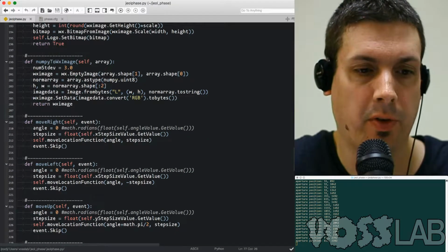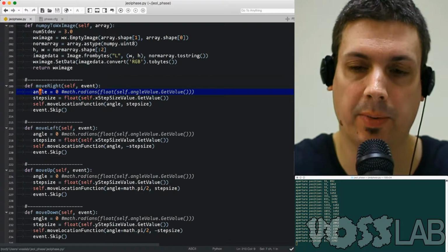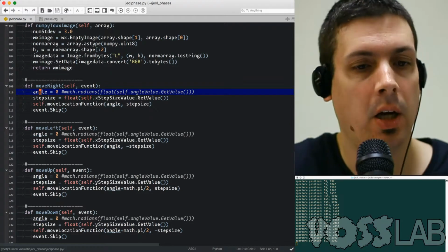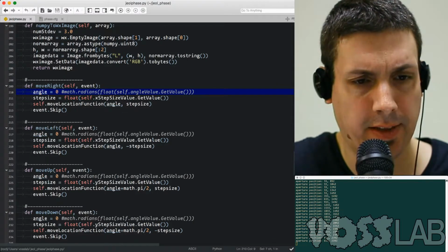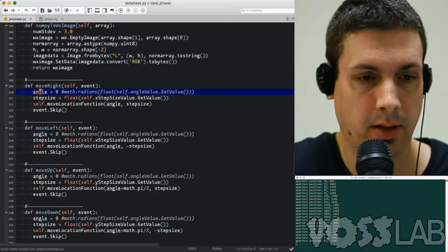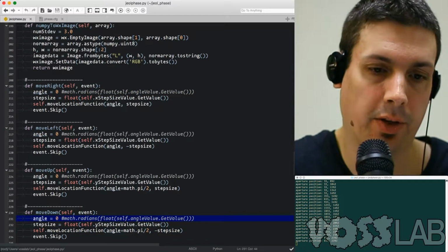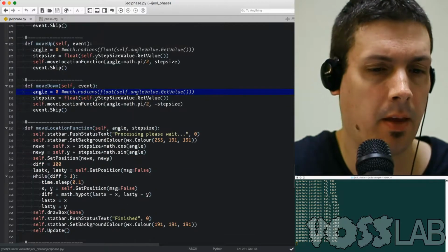Each function: move right, move up, down, move left. Angles are all 0 now. That's something we found out, the phase plate was actually well aligned with the aperture direction, so we didn't really need to implement angles, which is probably the hardest part of my code last time. So for the most part, I set the angle to 0, and then step size is either minus step size or plus step size, and I notice I have X's for left and right, and Y's for up and down. And I also tell it the angle's direction is pi over 2, depending on which direction you're going.